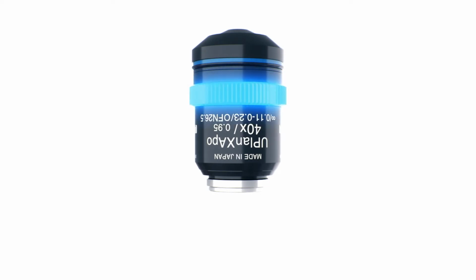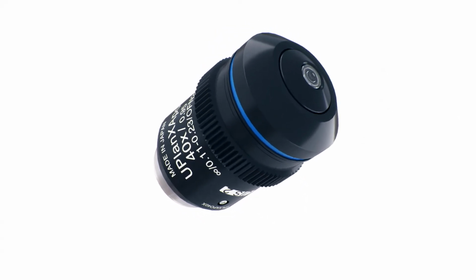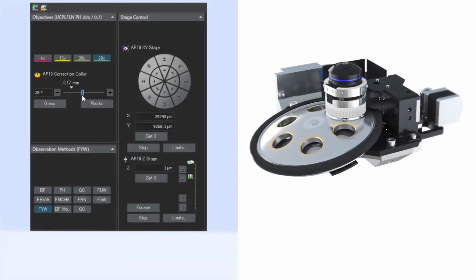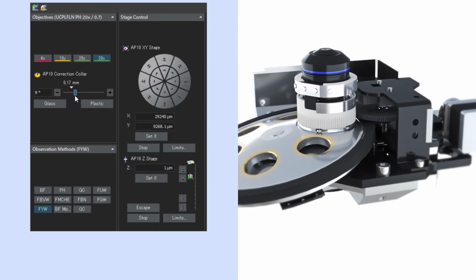Spherical aberration can be corrected by turning an objective's correction collar, but this is usually done by hand, which makes it difficult to adjust. The APX100 system's motorized correction collar enables you to make these adjustments with the software.